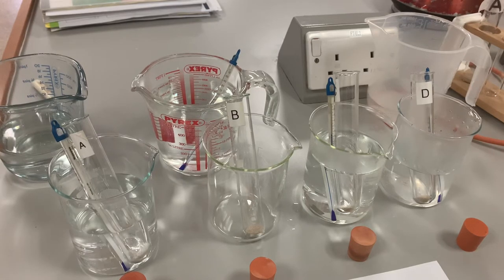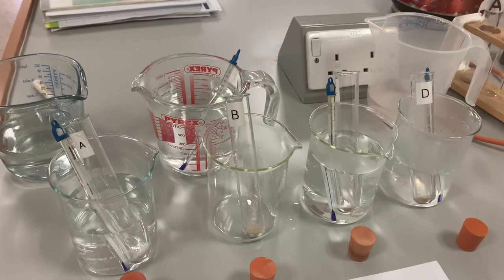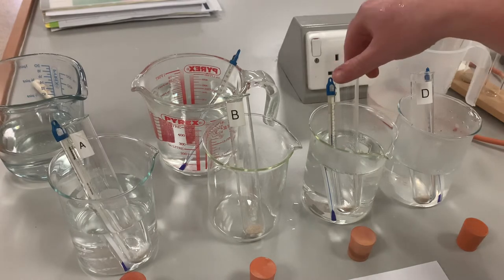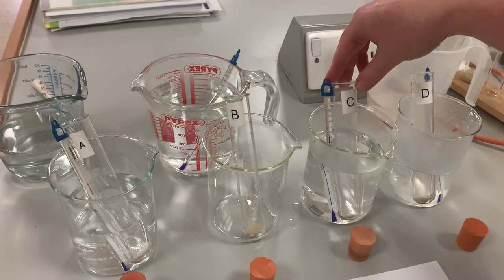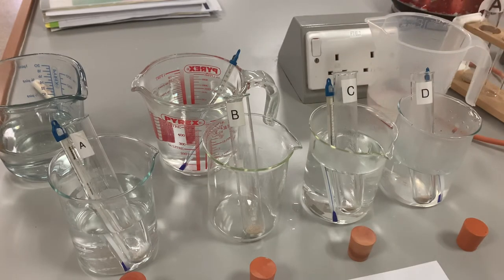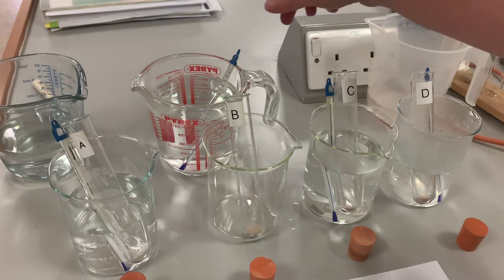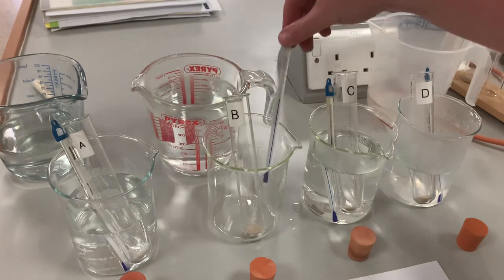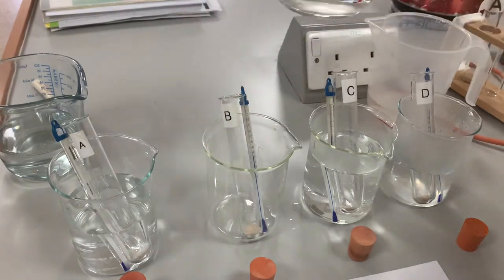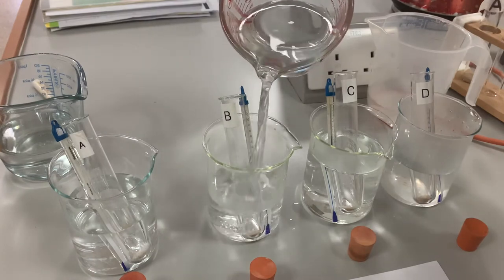Here is our setup for our first experiment to find out what temperature yeast would produce the most carbon dioxide. I've set up four boiling tubes in each of the different variables. A is cold water, B is 36 degrees, C is 56 degrees, and D is 76 degrees. I'm making sure that the right temperature is in each of the beakers.